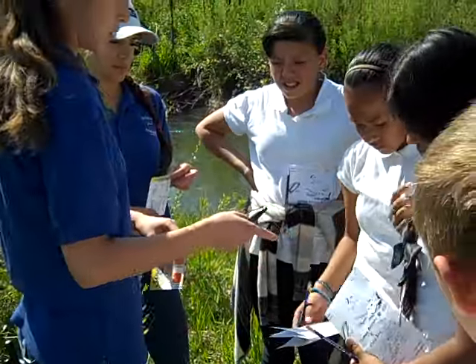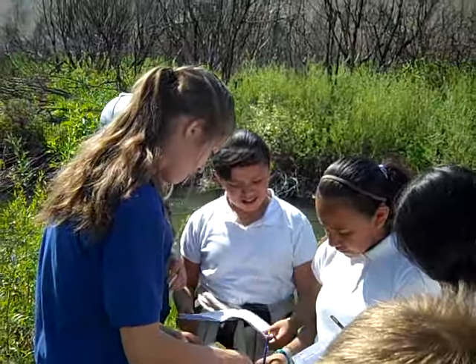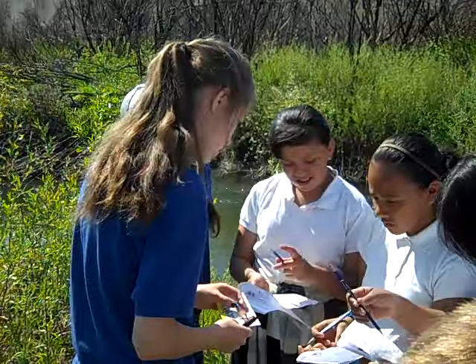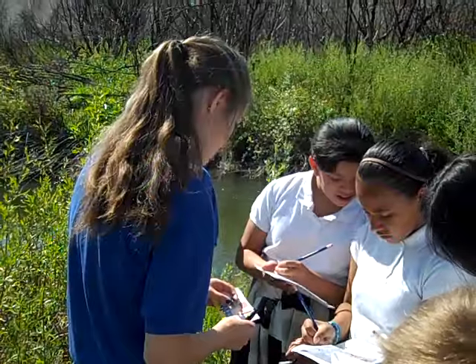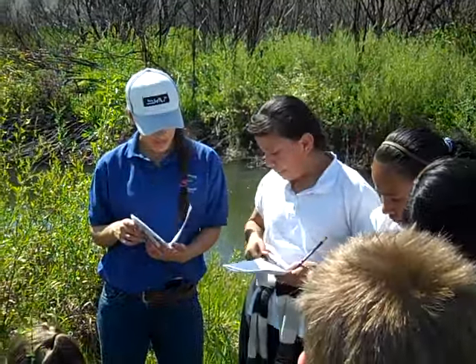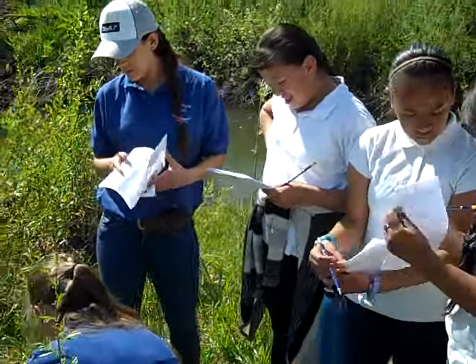So on your sheets there, you can put in, on that first sheet. Is it on there? Yeah, it's on there. You would put 4 ppm. The first page. Okay, and 4, then after that ppm. We'll do the one that's next to it.